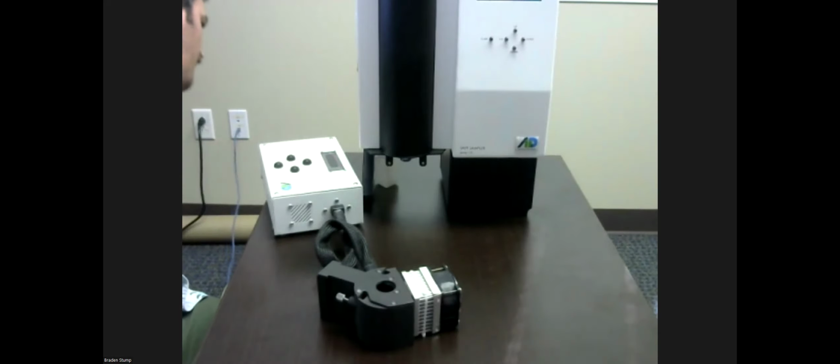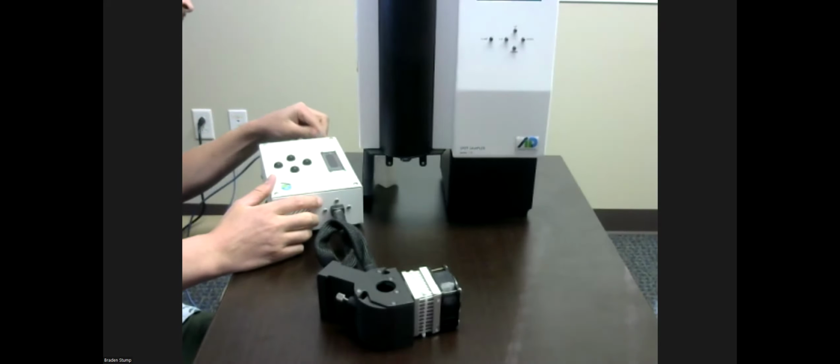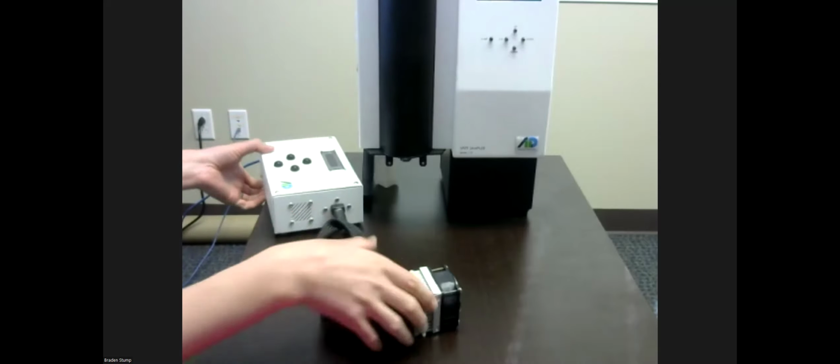We also have connected into the TLC here just to make it easier to connect to the internet. We also have an Ethernet cable here in the box. I will show that off as well. Power cable, USB cable, Ethernet cable, as well as a power switch right here.